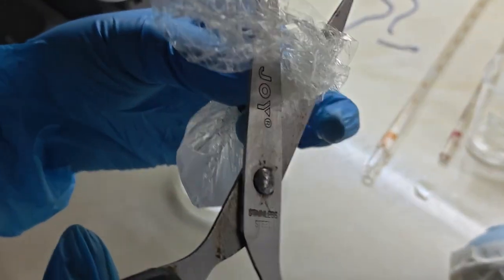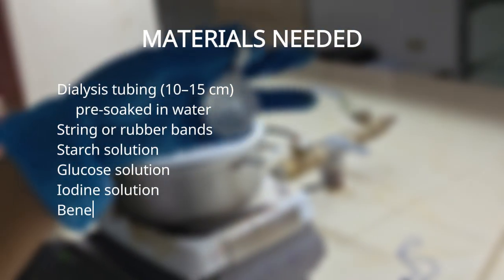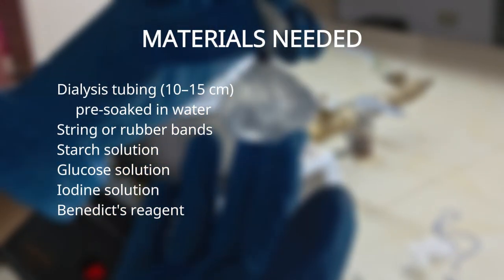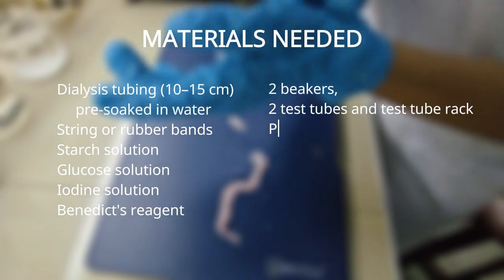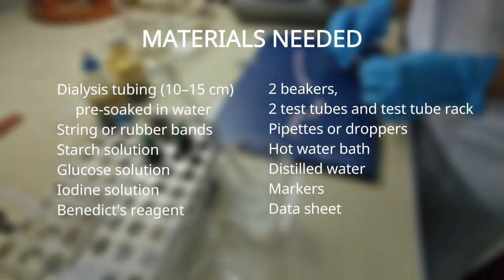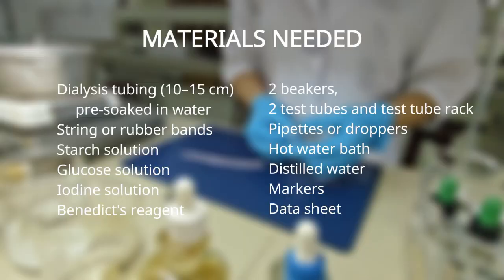For this experiment, I needed a dialysis tubing of 10 to 15 centimeters pre-soaked in water, string or rubber bands, starch solution, glucose solution, iodine solution, Benedict's reagent, 2 beakers, 2 test tubes, and a test tube rack. Then I needed pipettes or droppers, hot water bath, and distilled water, then a marker and data sheet.